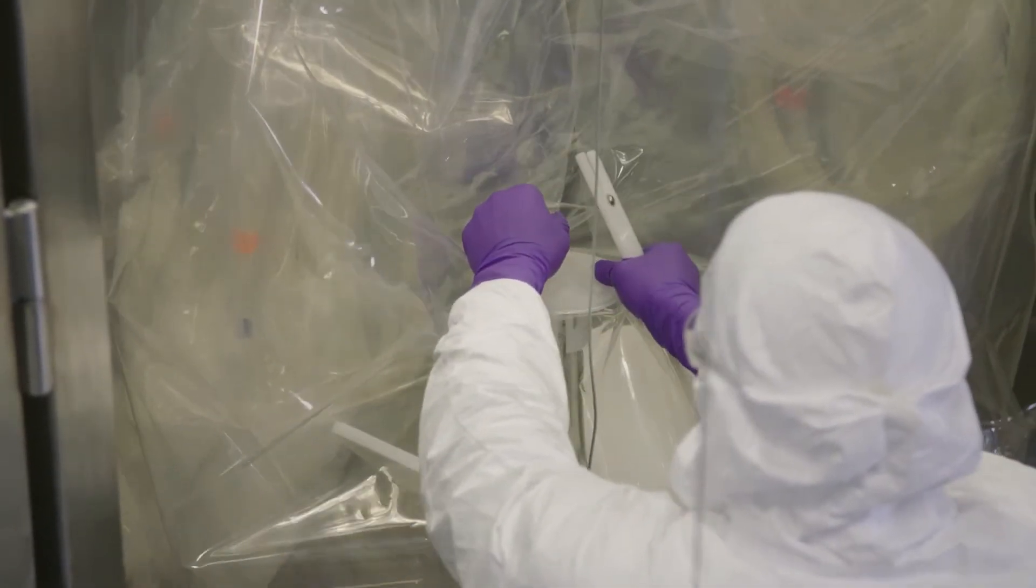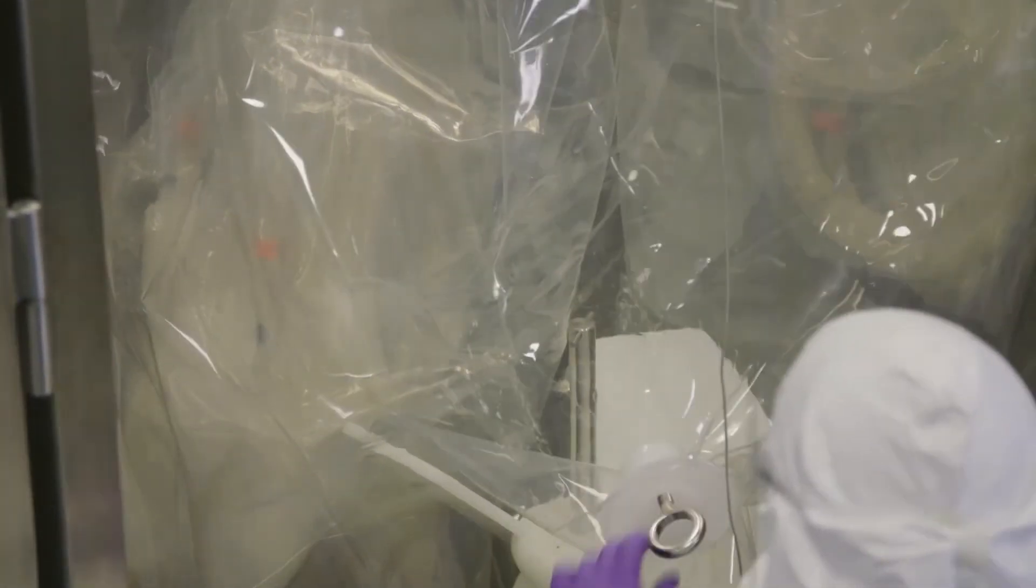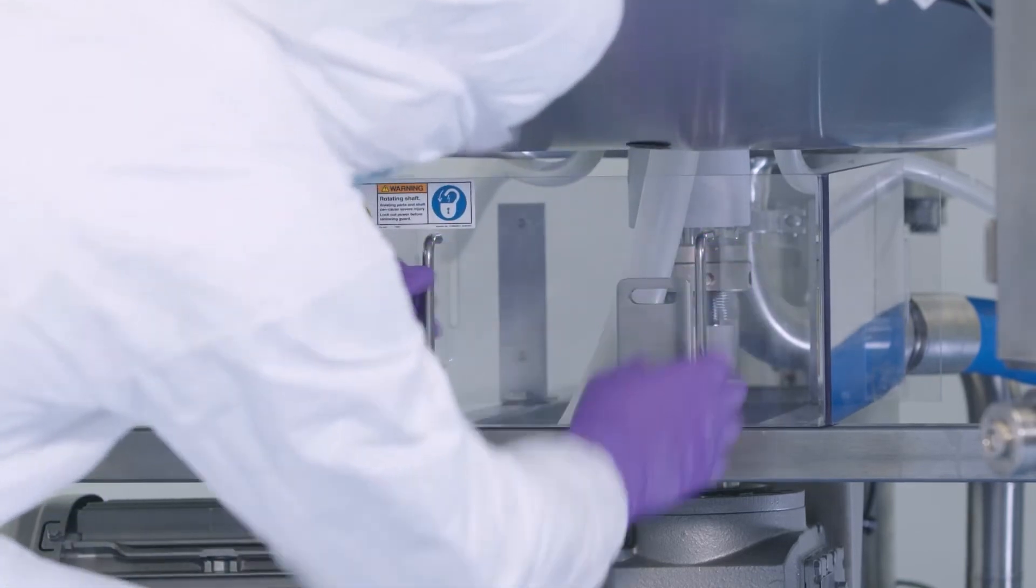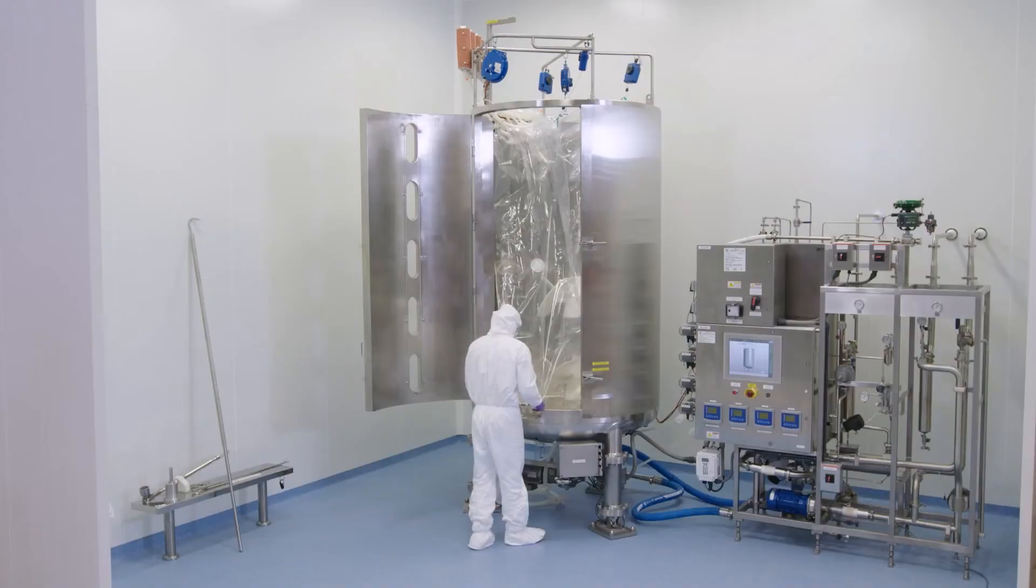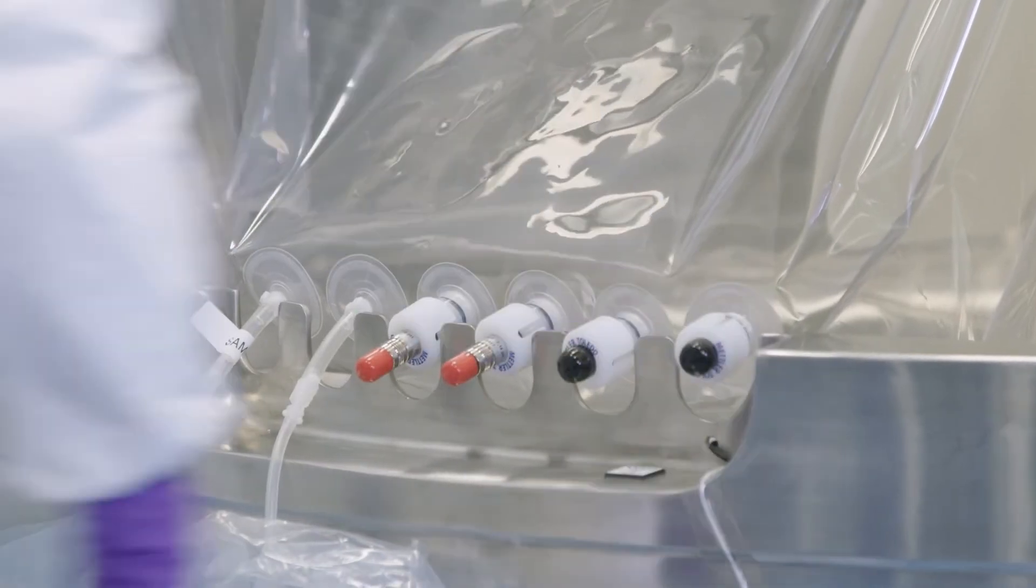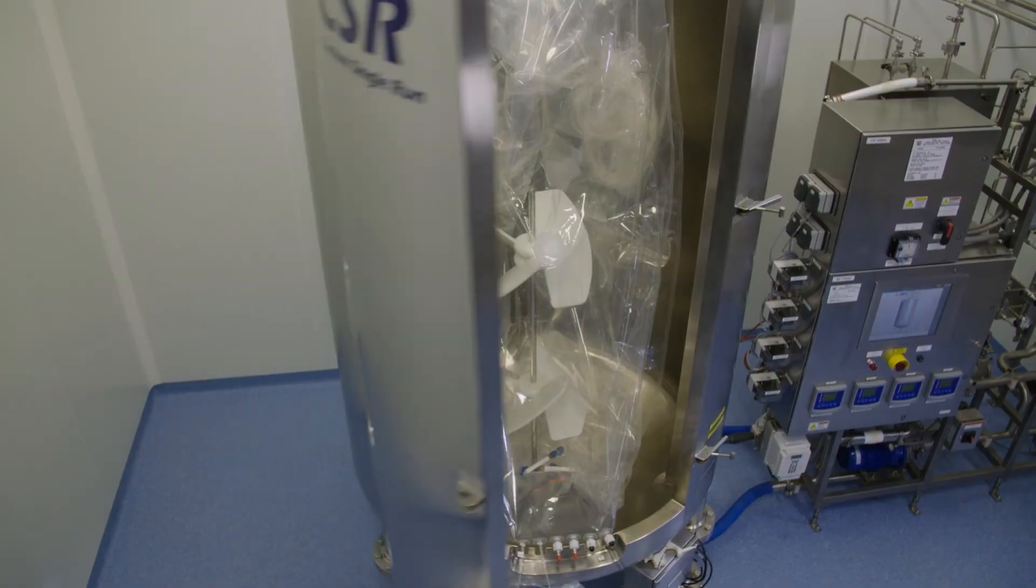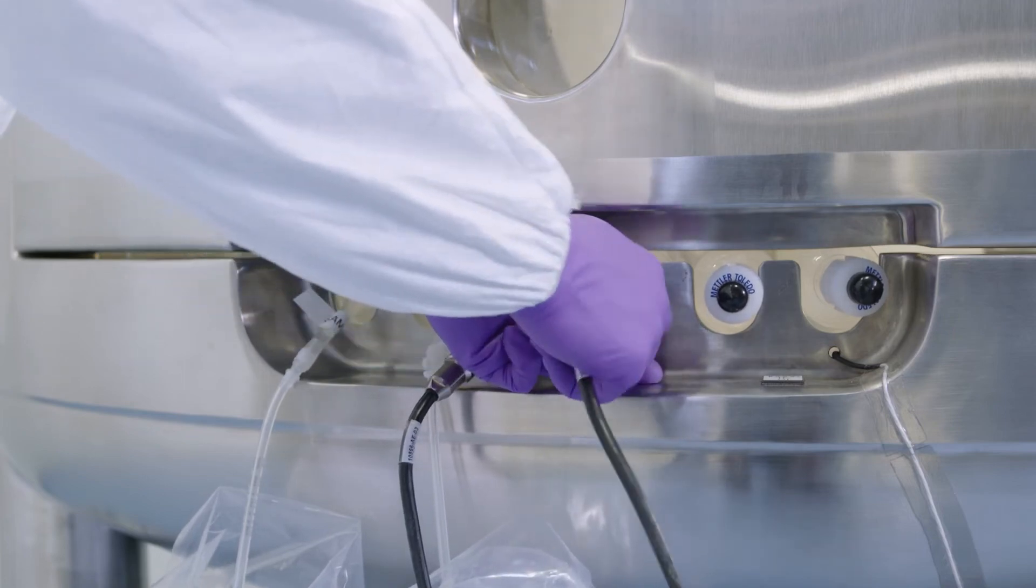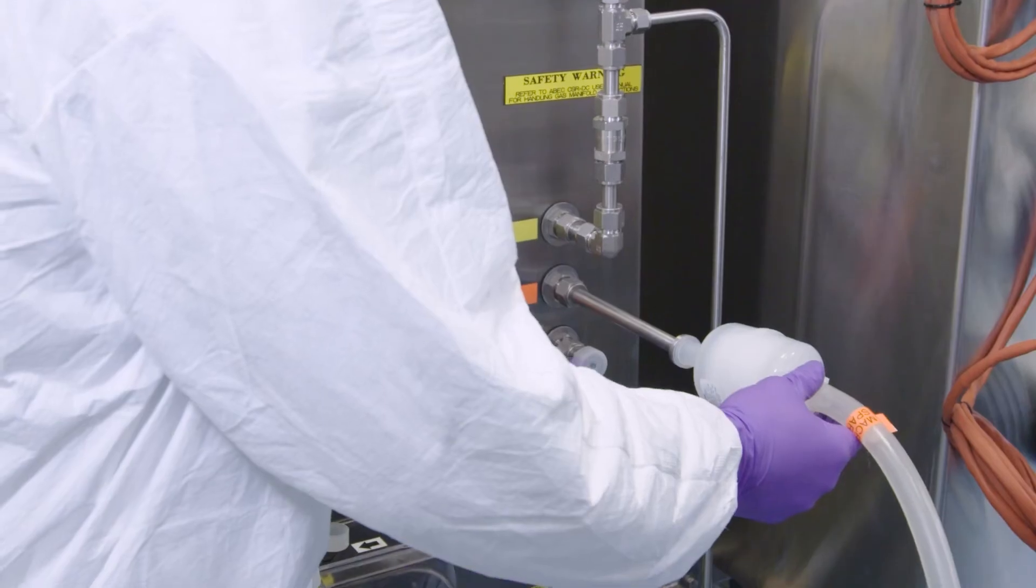Remove upper shaft coupling. Secure agitator shaft via mechanical coupling. Connect probes, filters, and tube sets.